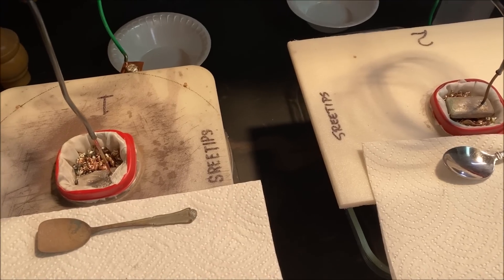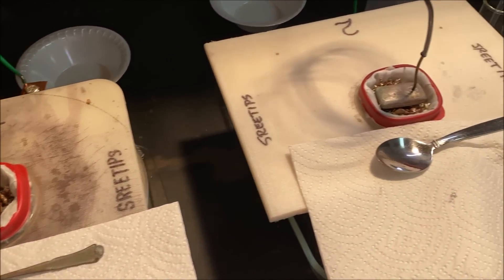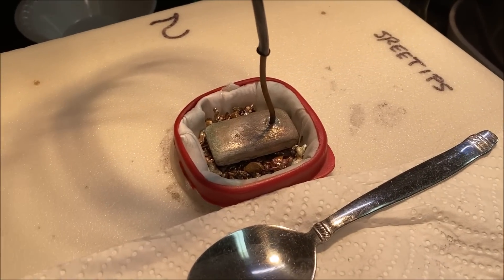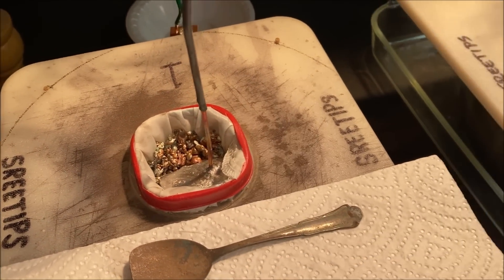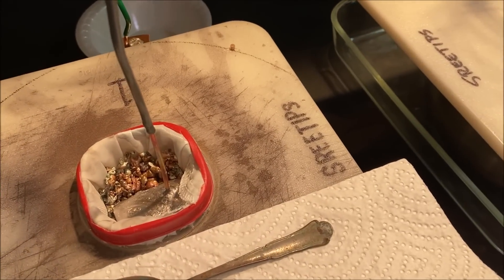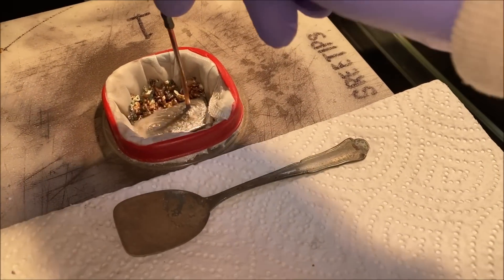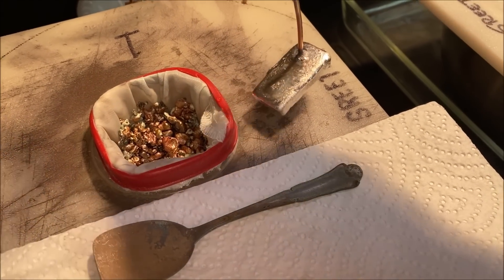Let's look down inside the beast. Oh yeah, look at that man, that is beautiful. The difference between the amount of silver that's left in these anode filter baskets is quite a lot of difference between these two.